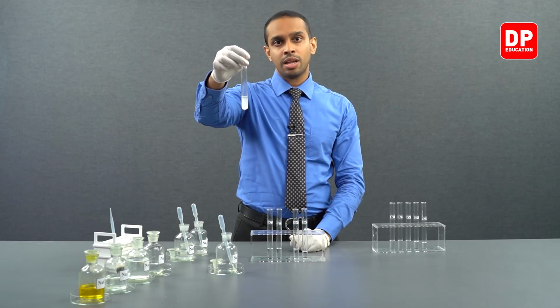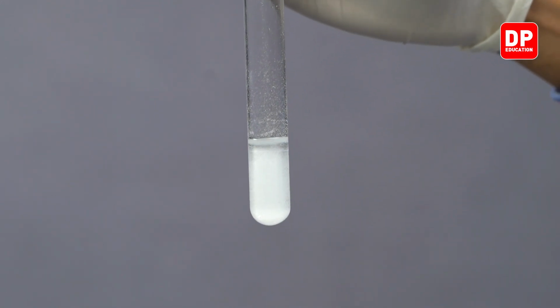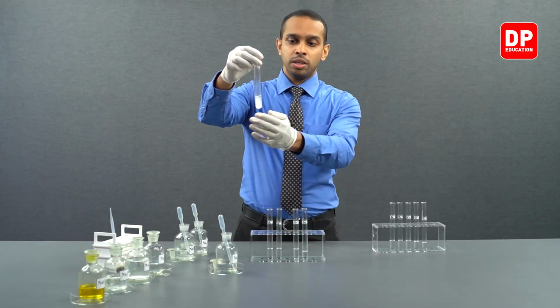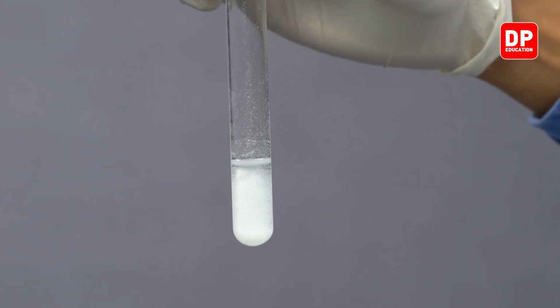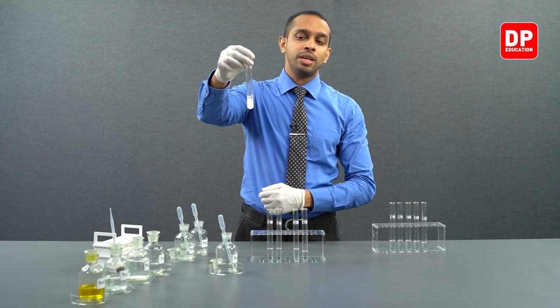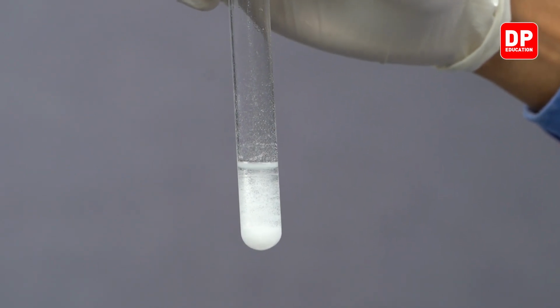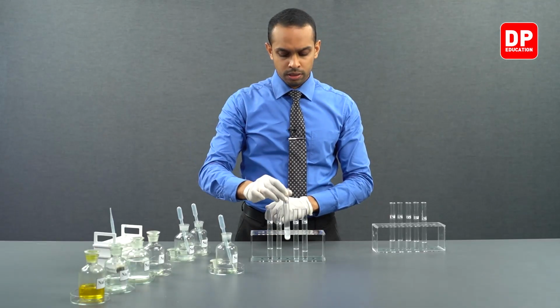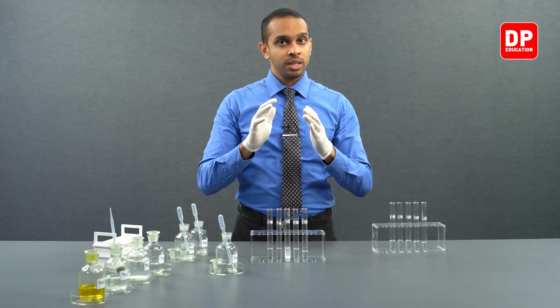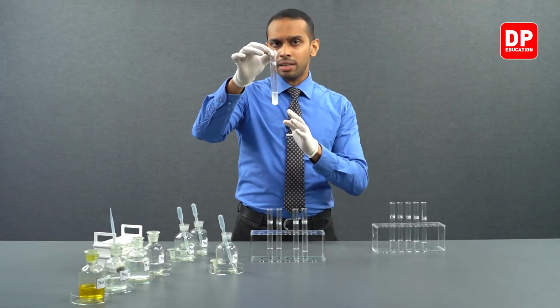Small amount of the calcium sulfate precipitate has dissolved in water. The remainder is dispersed in water, making this aqueous medium cloudy. Due to the fine calcium sulfate precipitate particles, you can see the aqueous medium here is appearing cloudy. And you can now see the precipitate particles are collecting at the bottom due to gravity. So keep in mind, magnesium sulfate was completely soluble in water. Calcium sulfate was sparingly soluble in water.